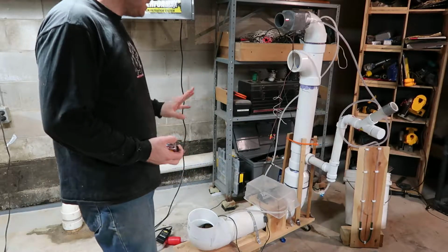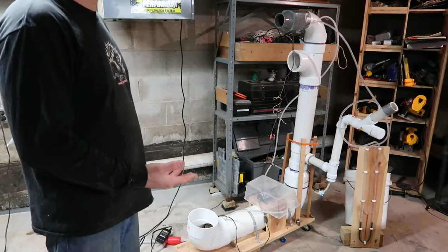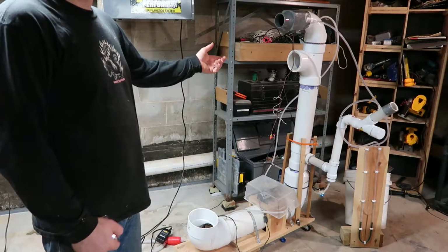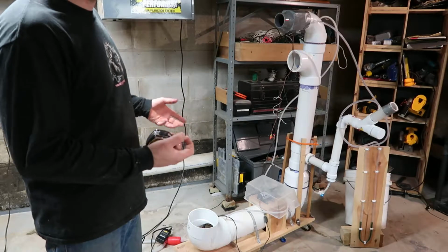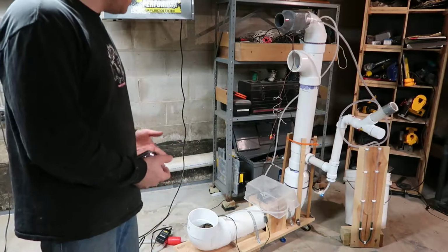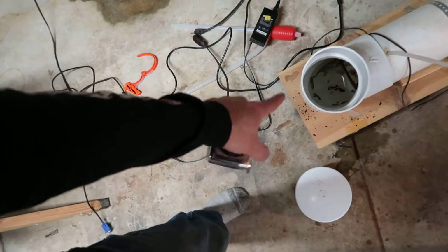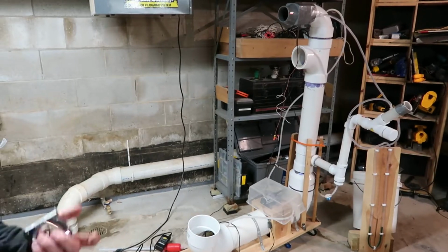And also a note on hygiene. This is a good bacterial reservoir if it's not high or low in pH. So between uses, make sure you empty it out, clean it, and run fresh water through it. The orifices for both the spray nozzles in this are pretty small, and they have a little tiny piece of glass wool in there that acts as a pre-filter, but they're easy enough to plug, so you don't want any kind of garbage building up in there. You could also put a little piece of foam over the end of that where it's drawing into the system. Just to give you an idea, that black junk in there is the slime rot from not cleaning the thing out properly. So you want to make sure you give it the maintenance that it deserves.